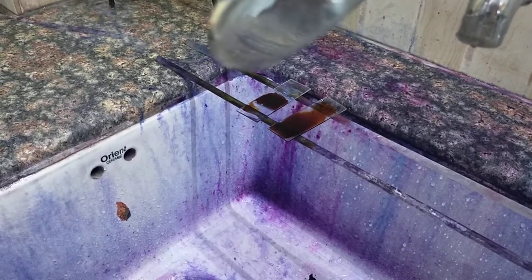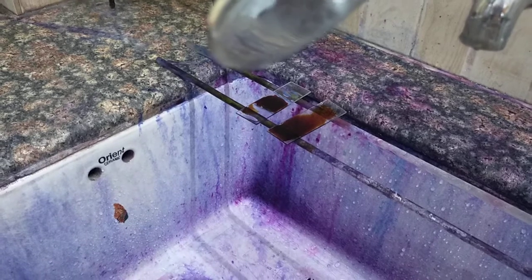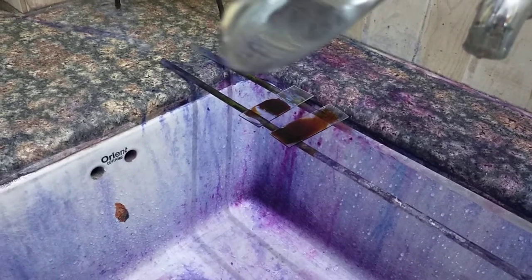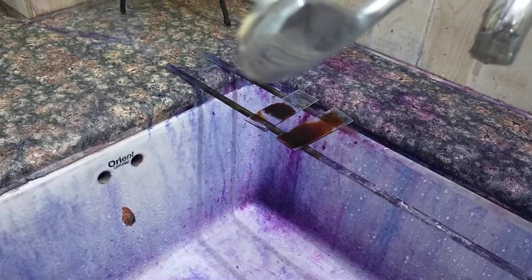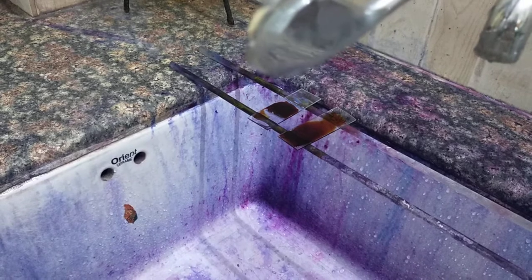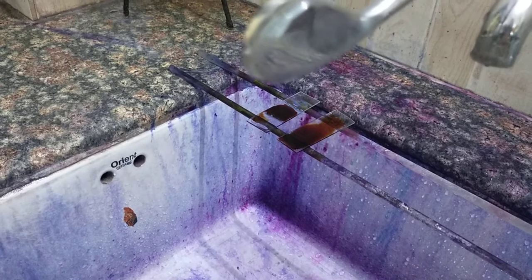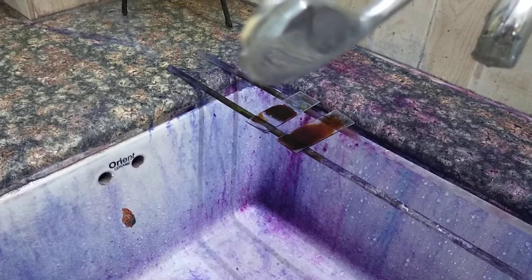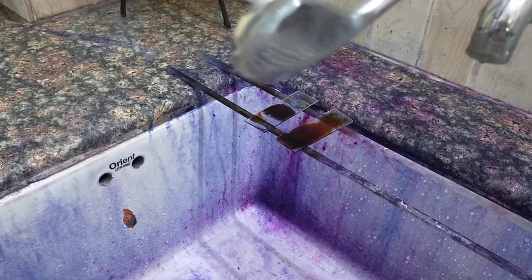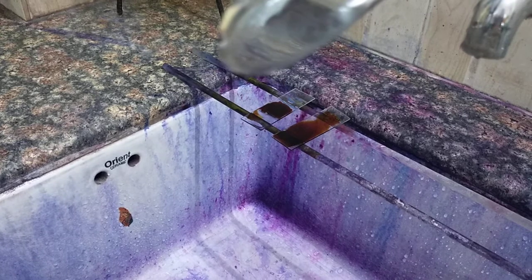So what is the use of Gram staining? First is to stain the bacteria and the cells. Second is to differentiate between gram positive and gram negative bacteria.